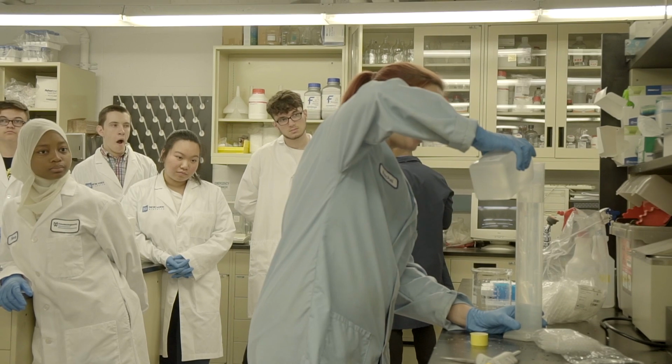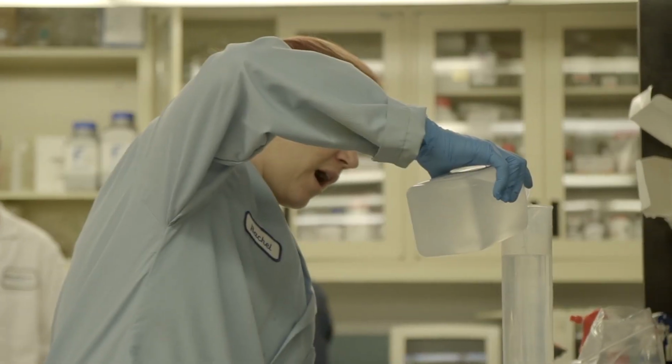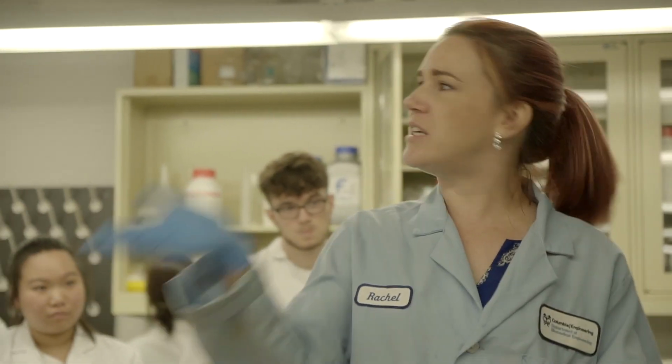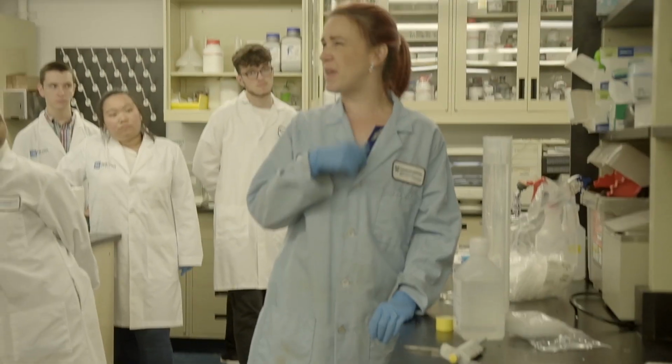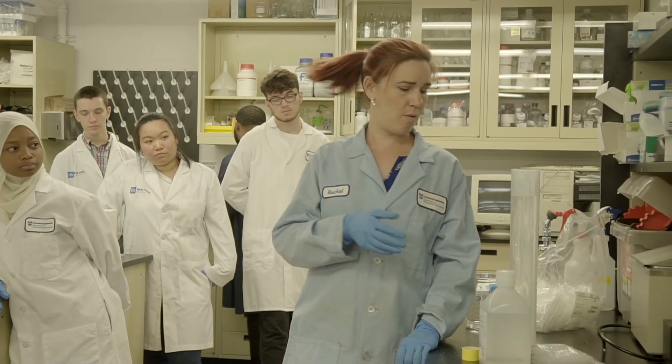Sometimes when your restriction digest doesn't work as expected and didn't cut everything, usually the first troubleshooting you do is to just increase the time. And it's okay if our restriction digests end up in the incubator longer than the time it says on the protocol, as long as we hit the minimum time that we know will work.